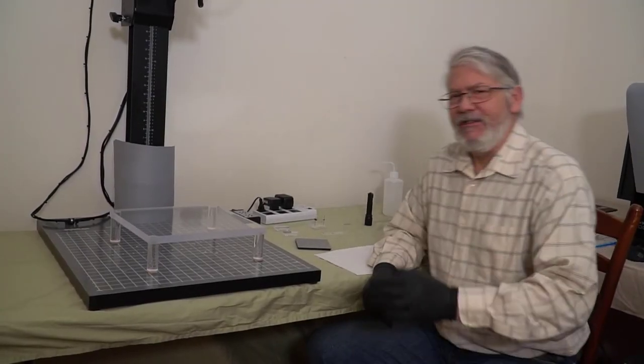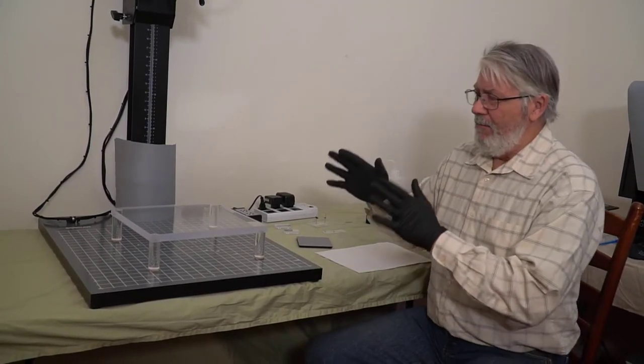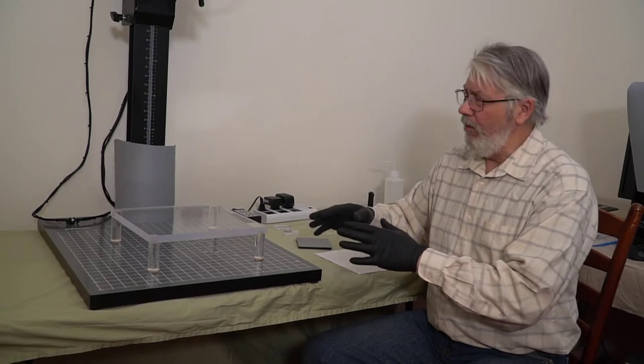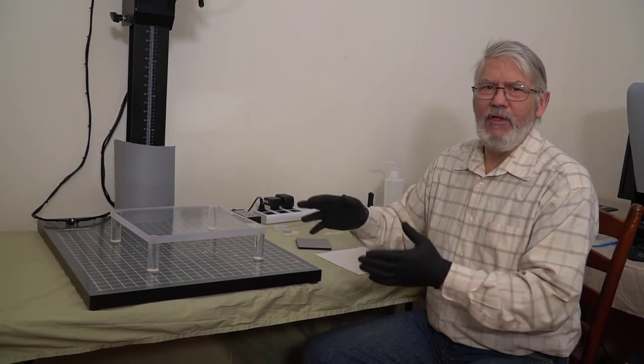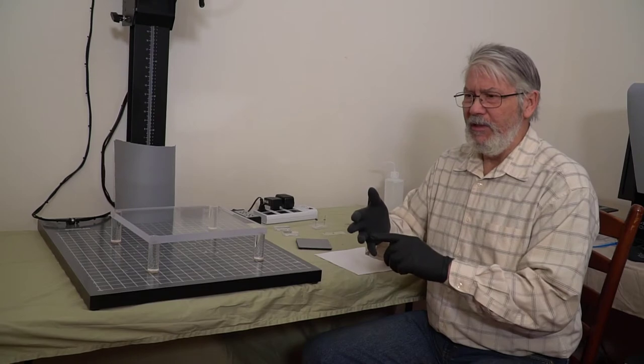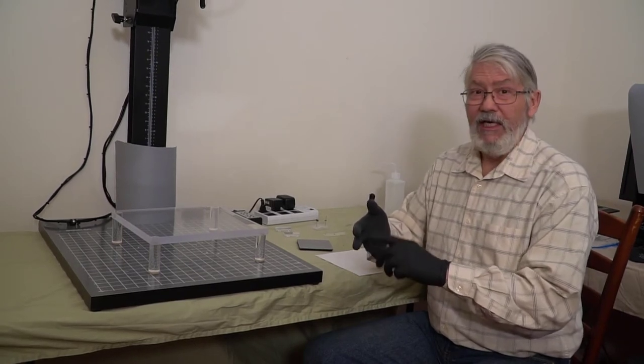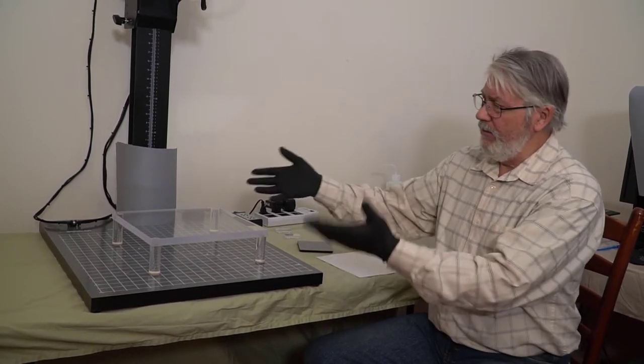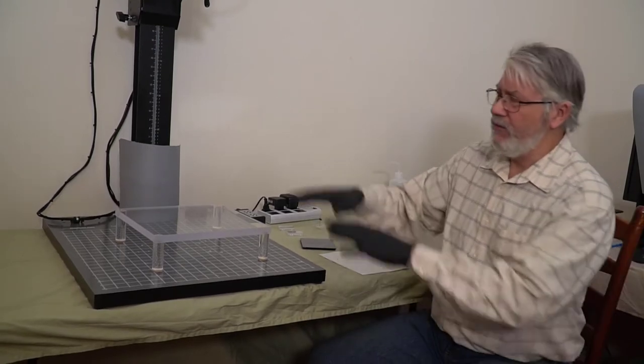Alright, this section is going to cover mounts and stages for all of your invertebrate zoological needs. This includes pin mounted, point mounted, and shooting in ethanol, as well as some of the larger material you may have that you're just going to lay on the base plate.